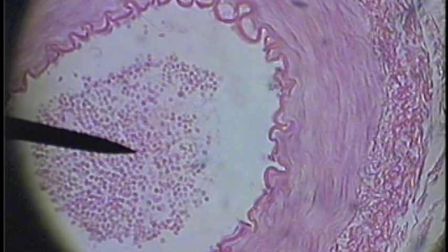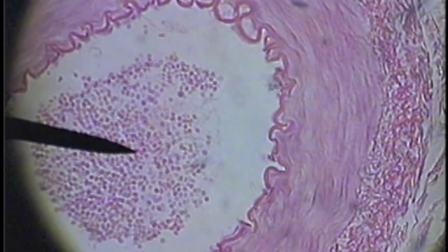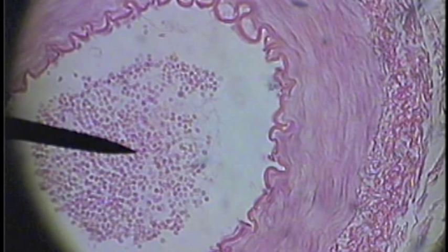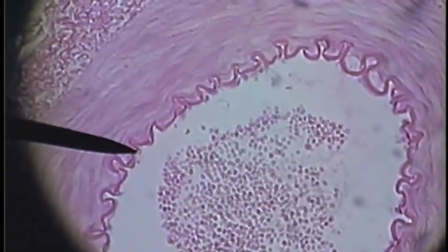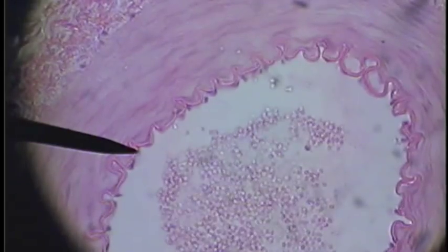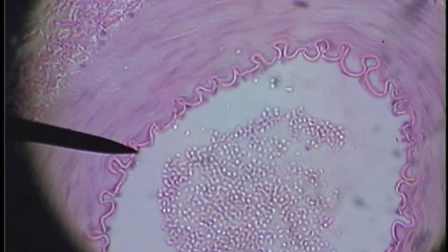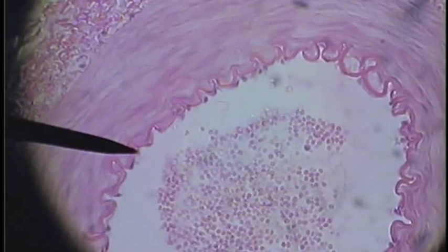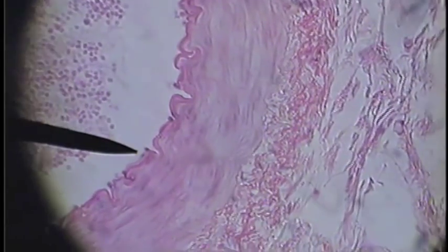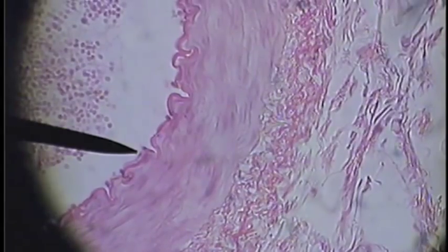Around the outside we can see two — actually three — distinctive layers, which I will point out now. The pointer is on the tunica interna, and in the field of view you can see the hot pink or bright pink neon elastic membrane. The pointer is on that, and you can see little nuclei on the outside of that, or close to the lumen. Those are the nuclei of endothelial cells.